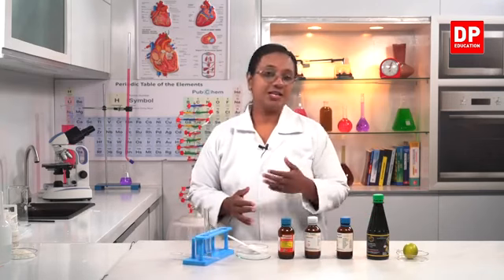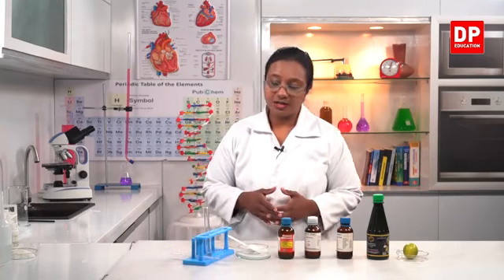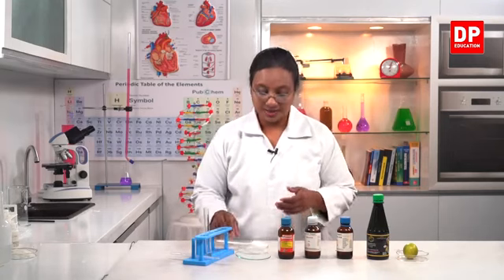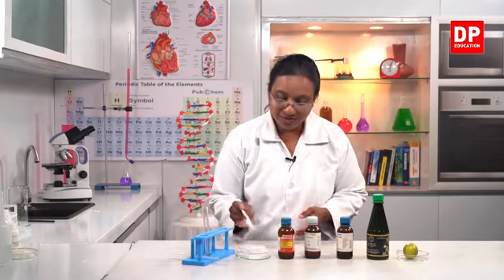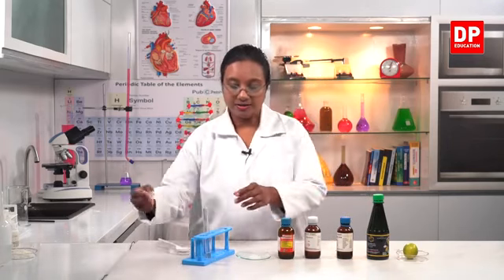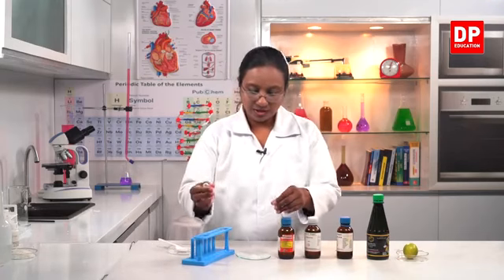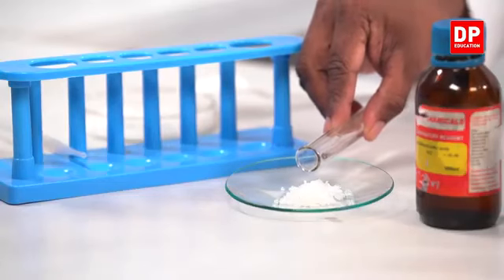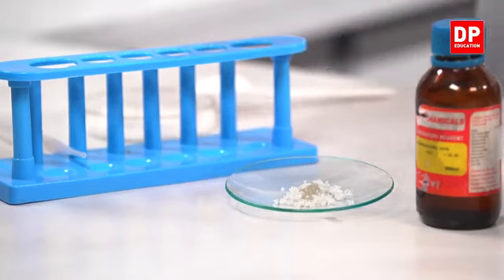To observe this property of sulfuric acid, that is concentrated sulfuric acid, inside the test tube I have the concentrated sulfuric acid, and here I have a sample of sugar. So I'll take it, transfer a small amount into the watch glass. Now when I add a small amount of concentrated sulfuric acid, you have to remember students, it has to be concentrated sulfuric acid. When I pour it onto the sample, observe the color change.